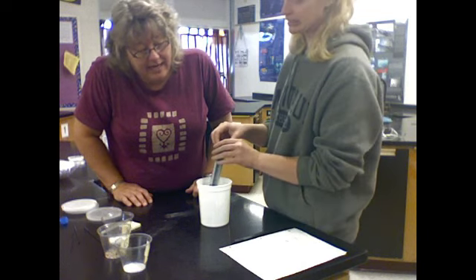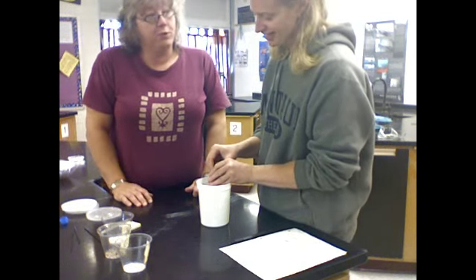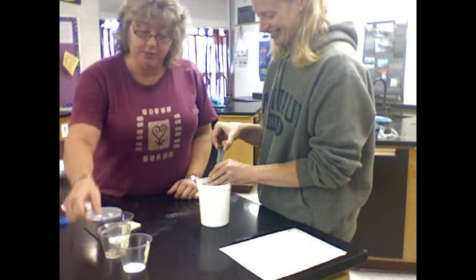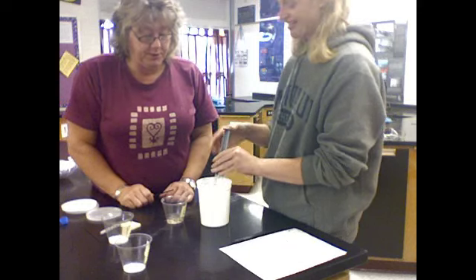So we're going to put this in the gravel first. So right up to the line there. And we're going to slowly add it to the water. Remember, tools, not toys.